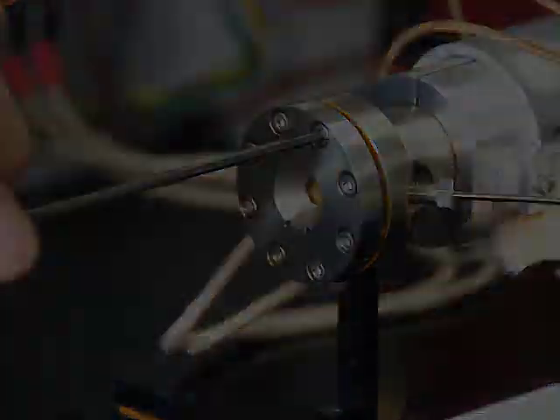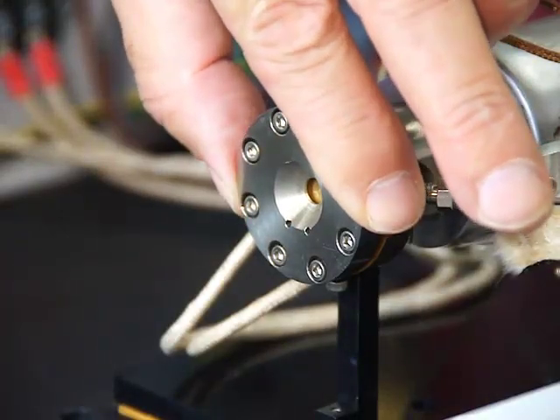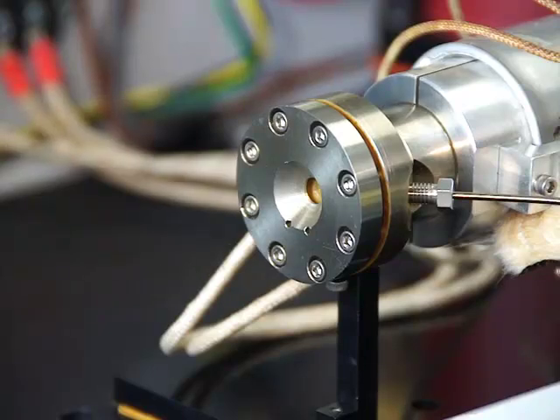Do not over tighten. Maintain slack in the end cap which will allow room for thermal expansion of the metal upon heating.